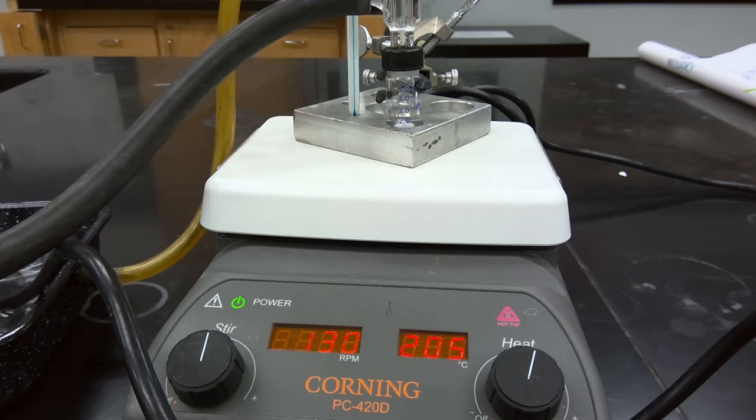We'll then be able to isolate our product first via extraction to remove the acidic component, followed by distillation to isolate the desired isopentyl acetate product. The isopentyl acetate product has quite a distinct smell. It's often used as an additive which has a banana-like smell.